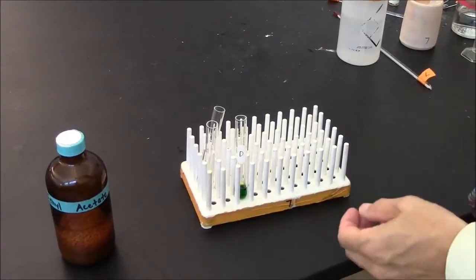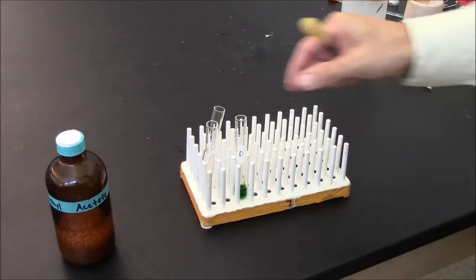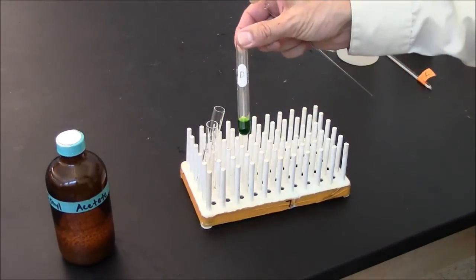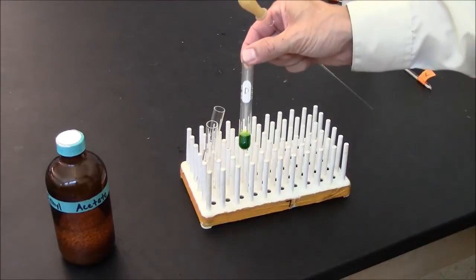Here I'm showing how to do a very small scale organic extraction. I have here an aqueous solution that has some colorful molecules within it.